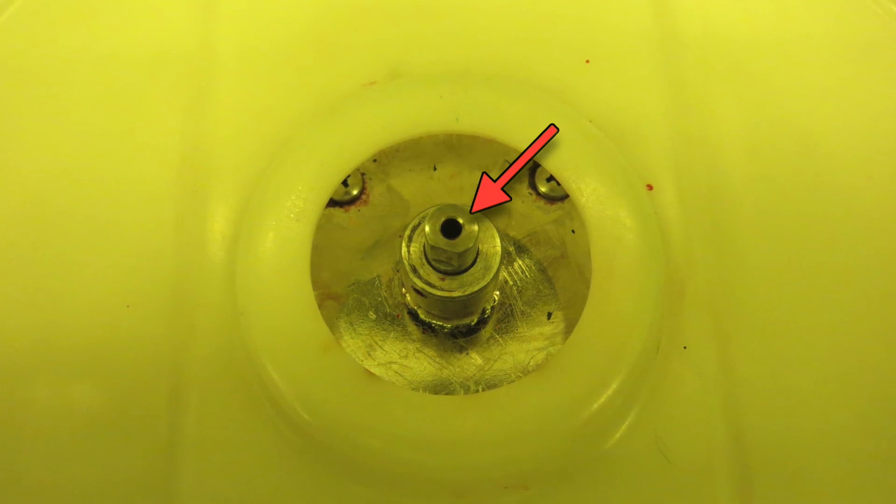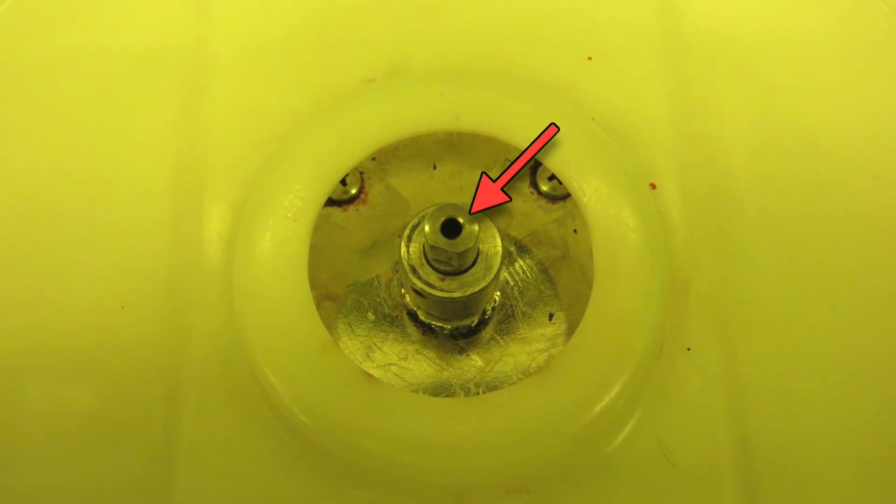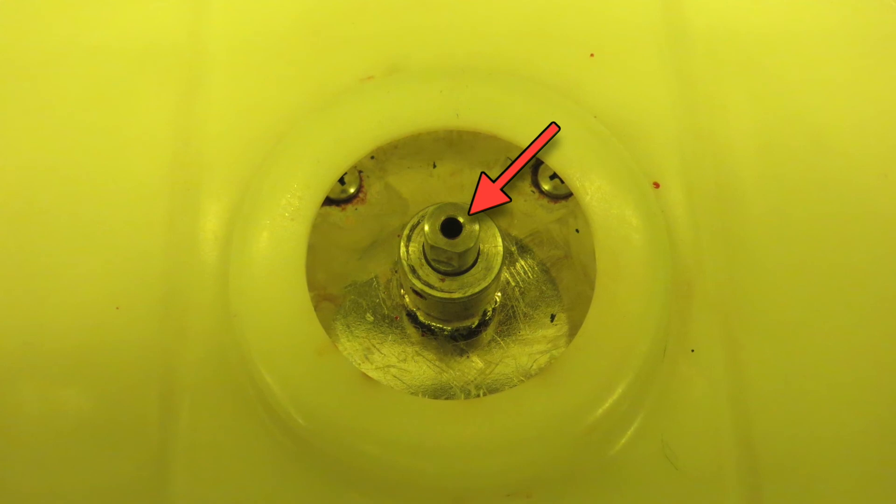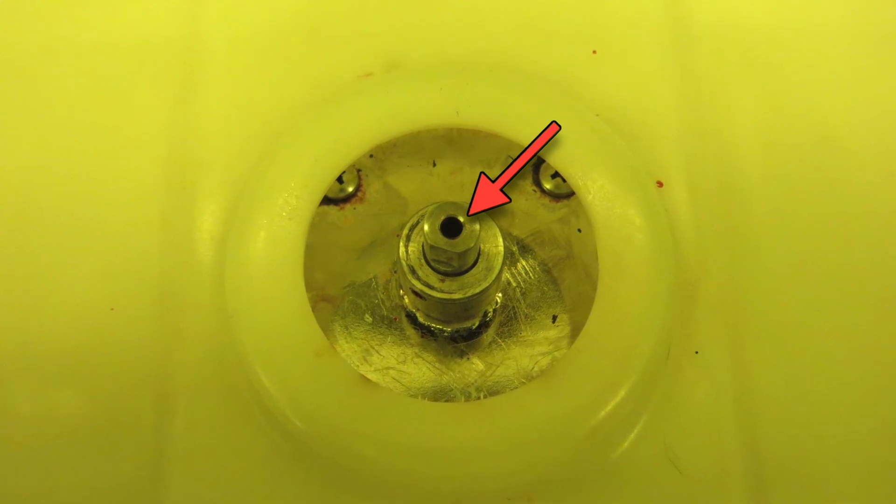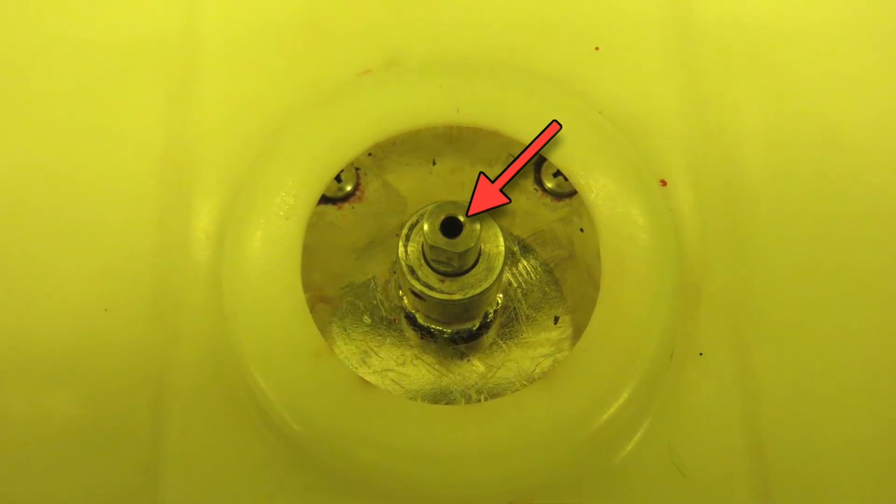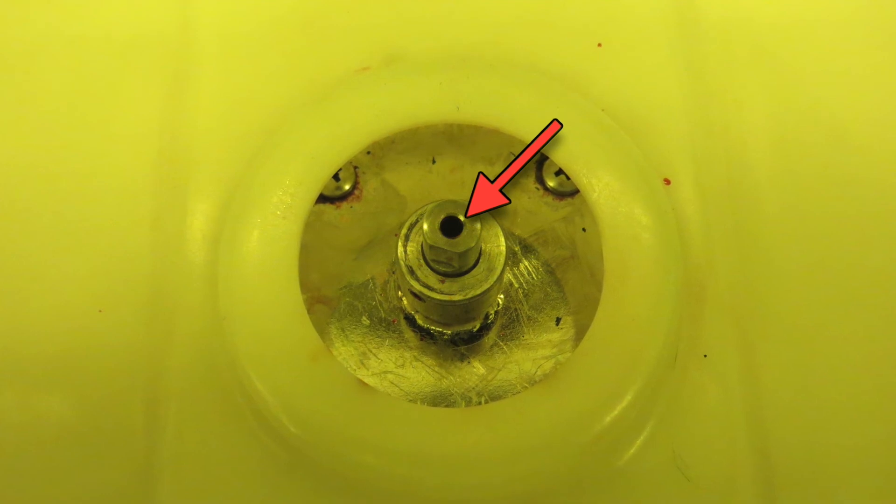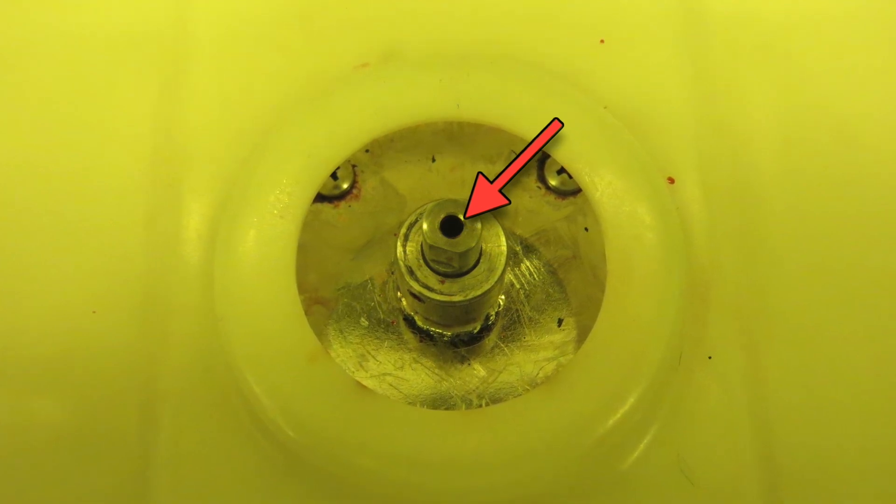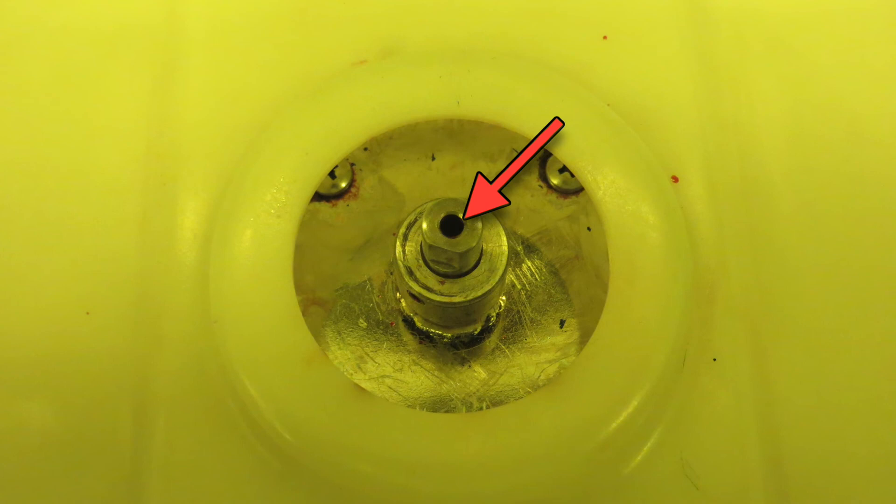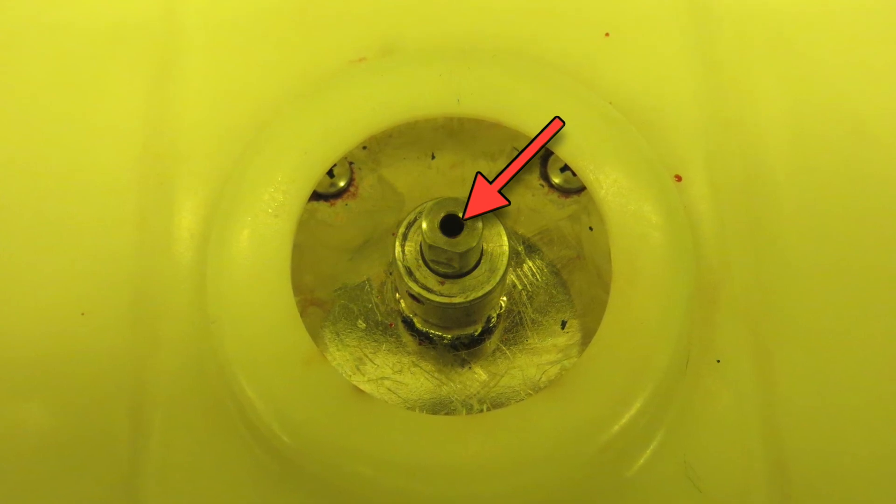There is a vacuum hole in the center of the motor shaft. It is very, very important that you never allow any photoresist or solvents to go down this hole. Any liquids going down this hole will wind up clogging the vacuum circuit and ruining the motor bearings, the vacuum sensor, and the vacuum solenoid. So it is imperative that you use a chuck that is suitable for the size of wafer or chip that you are going to be spinning.